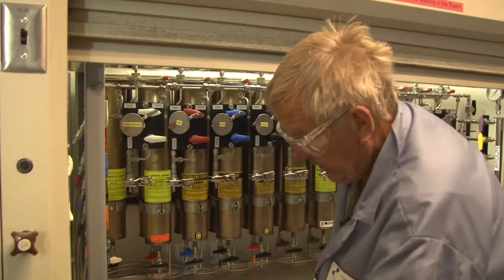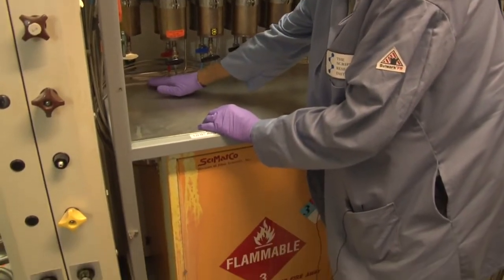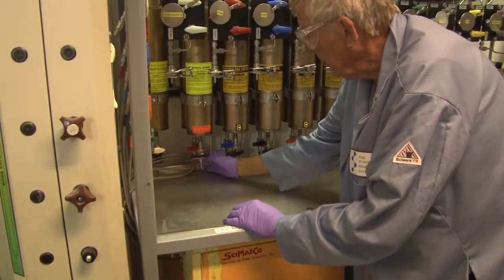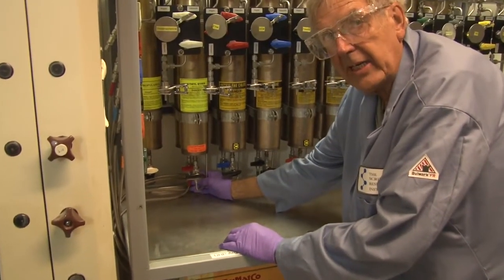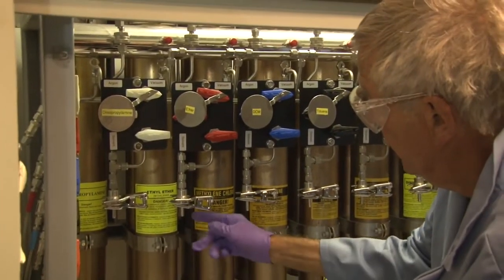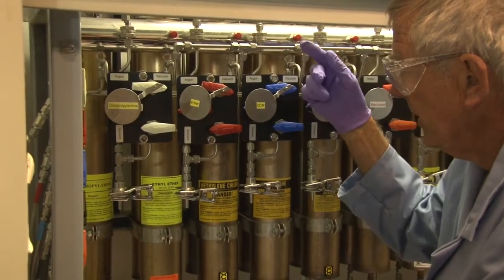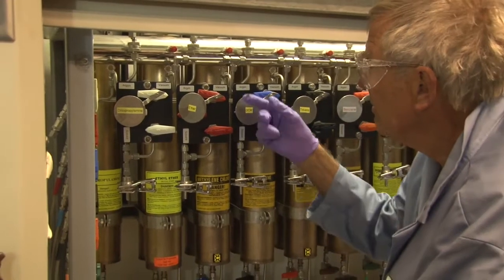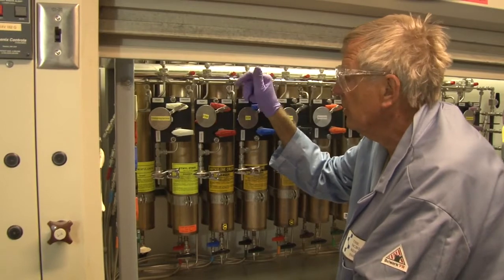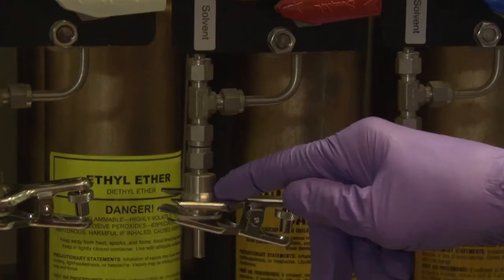The kegs are in the flameproof cabinet. The solvent hoses come up through the wall of the cabinet connecting to the bottom of the back column. The back column is connected via a tube to the front column. So it comes in the back, comes out the top, comes over to the front bottom, and comes out the front column towards the take-off location, which is here.